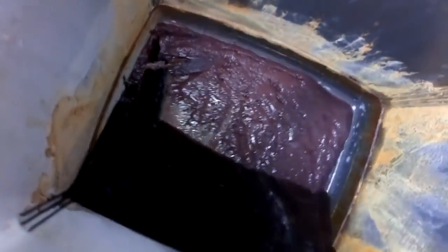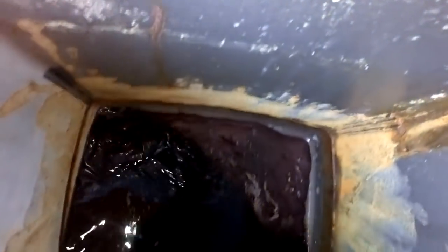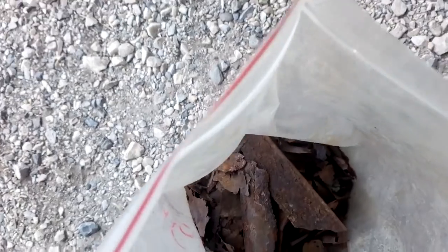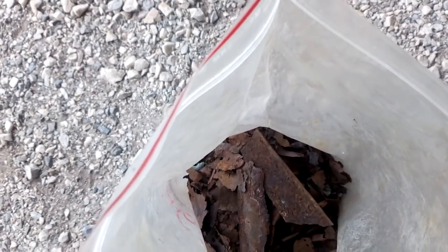Here in this bucket I got some copper which I already collected — see that — and now this is just a water wash. I wash it right now. After I wash that I put it out to dry, and after all that process you will get this — see that, this is pure copper, which is cemented from solutions like AP, aqua regia, or waste acid. Here in this bag I got maybe four kilograms, and I have one more bag in the porch.